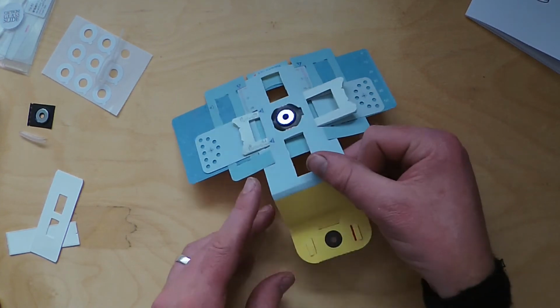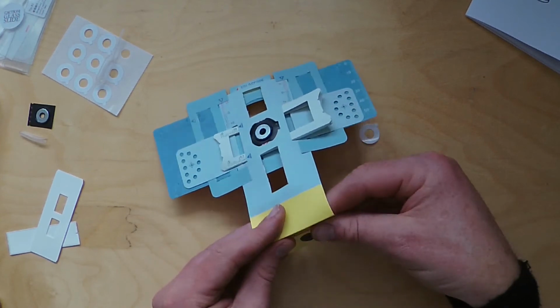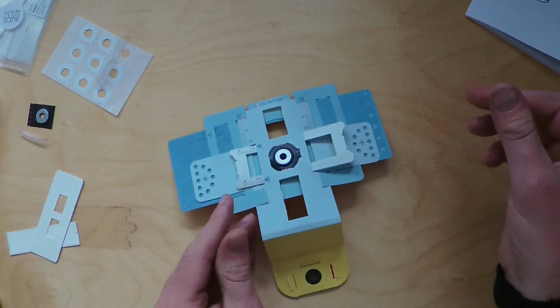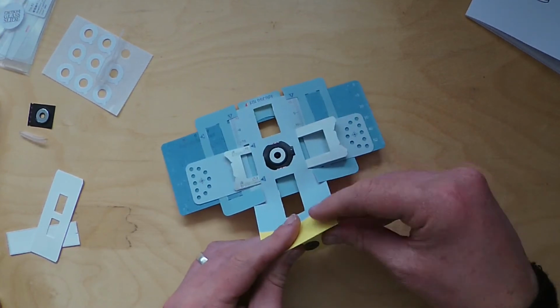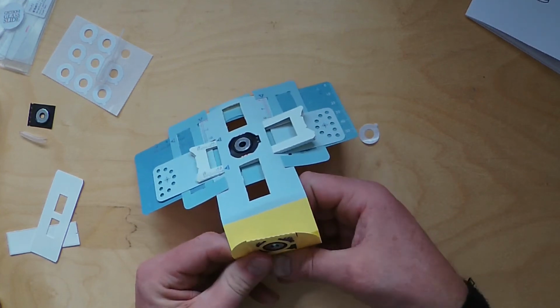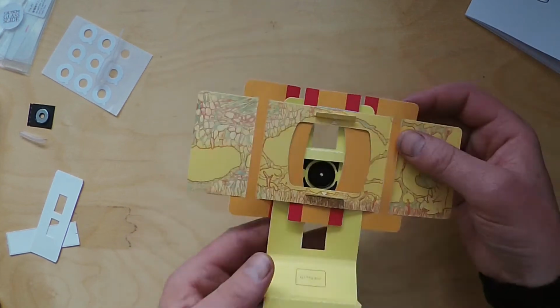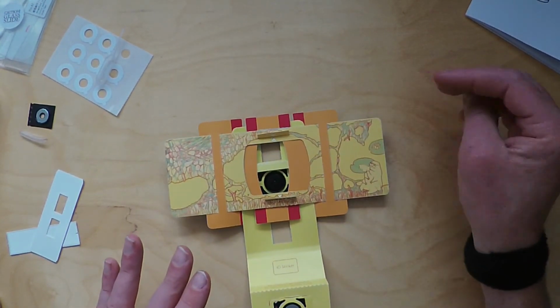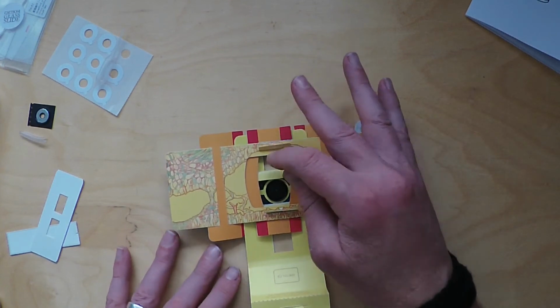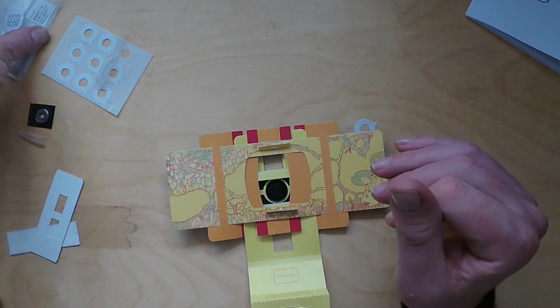Now turn yourselves to that last fold again, up, everything else is folded down. Okay, so it should sit like this now. So when you flip it over, it sort of sits a little bit like that. Now let's try and put our slide in.